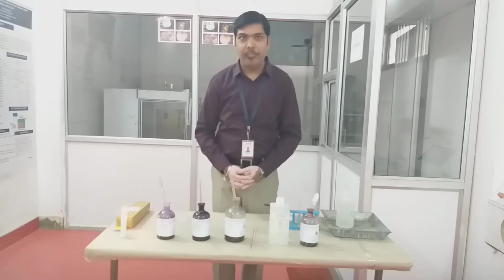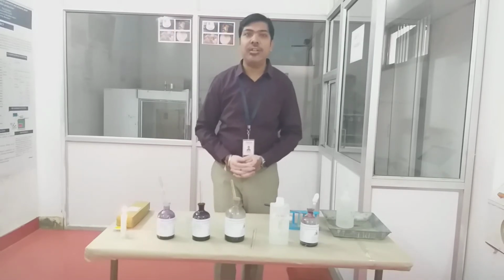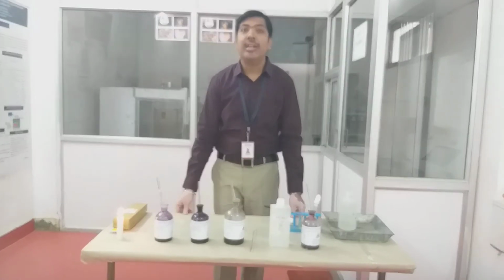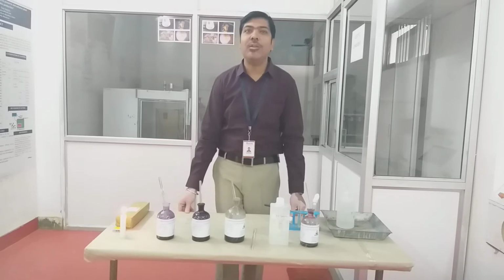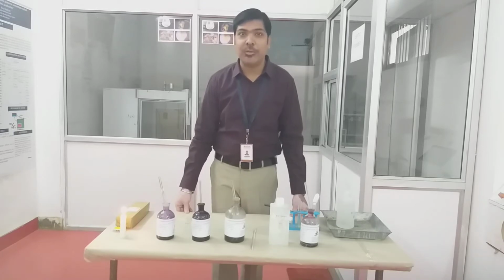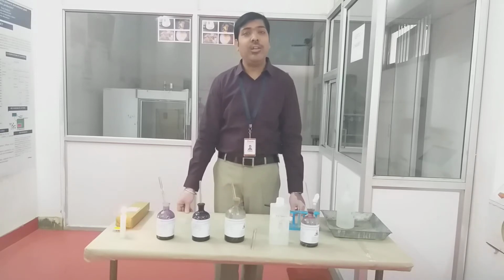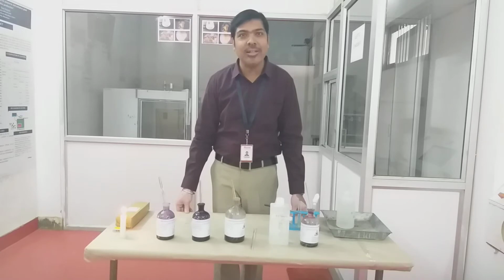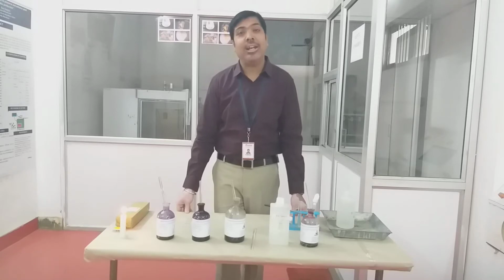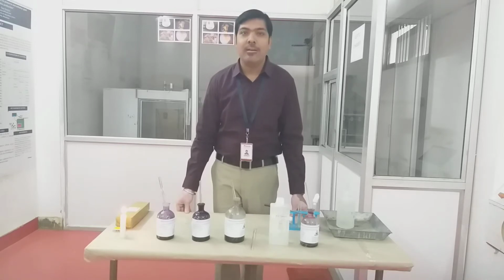our laboratory. We know that the staining procedure plays a very important role in the visualization of microorganisms, especially bacteria, because bacteria have a somewhat transparent or semi-transparent structure. So that's why under your light microscope or the compound microscope, these microorganisms are not clearly visible. If we impart a specific color to these microorganisms, then the features of the bacteria can easily be visible. That can help us in the characterization and identification of different categories of bacteria.